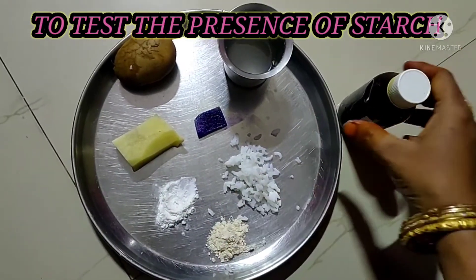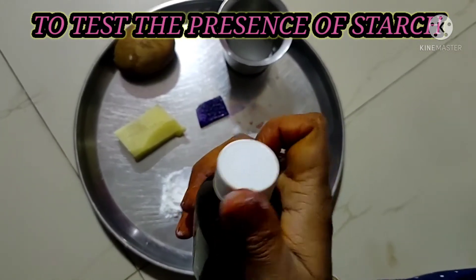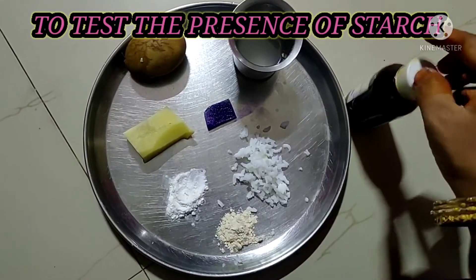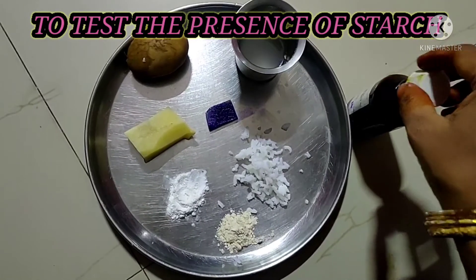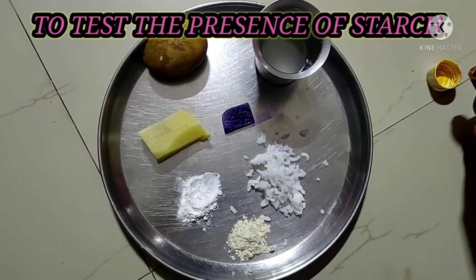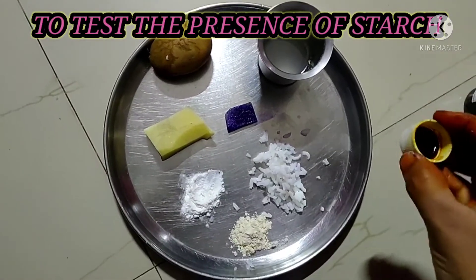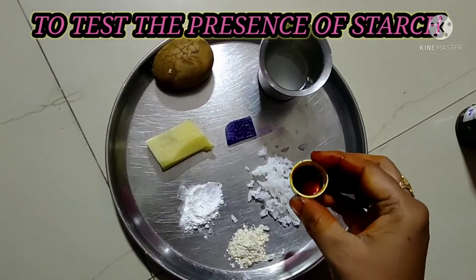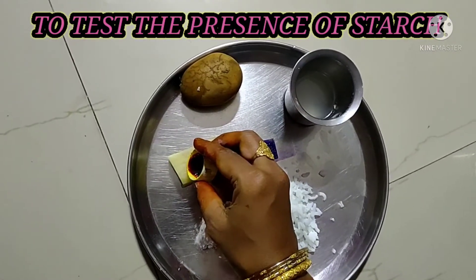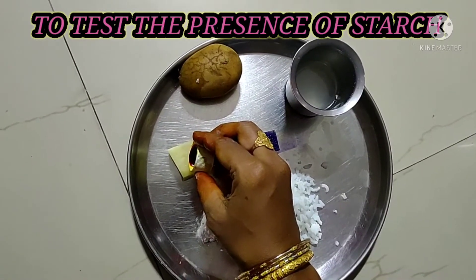So now let us conduct the activity. This is the iodine solution. Remove the cap and pour some iodine on each food item. We will test whether these food items contain carbohydrates or not. The first one is potato.